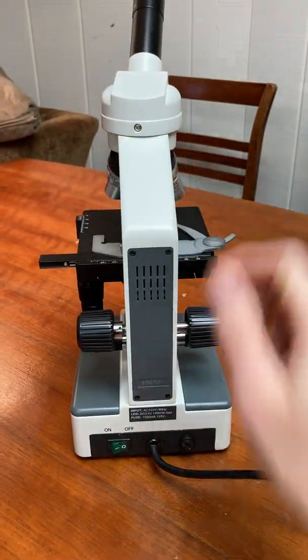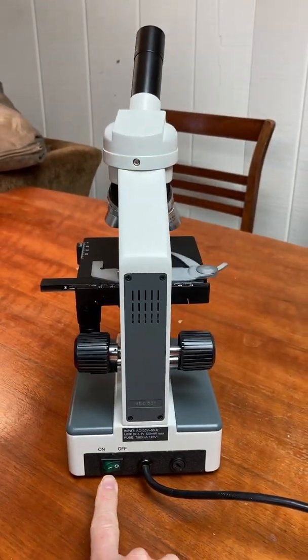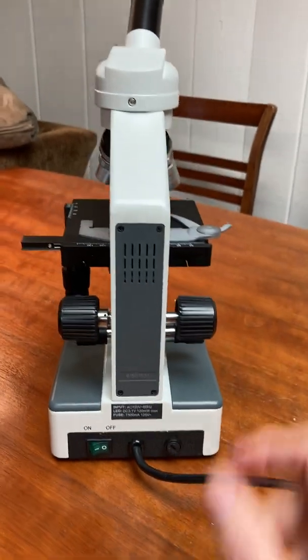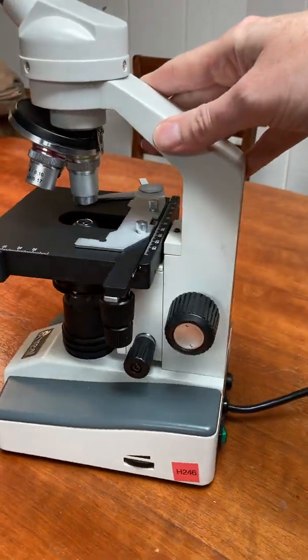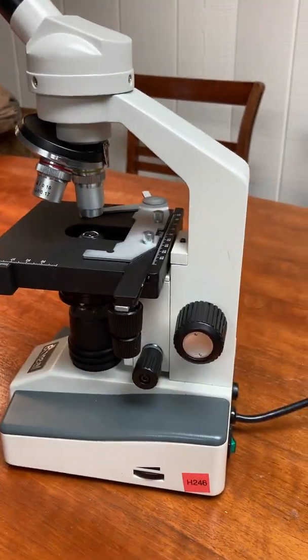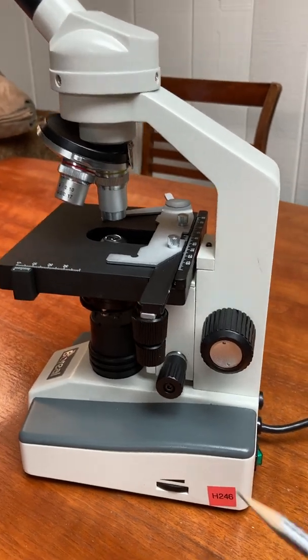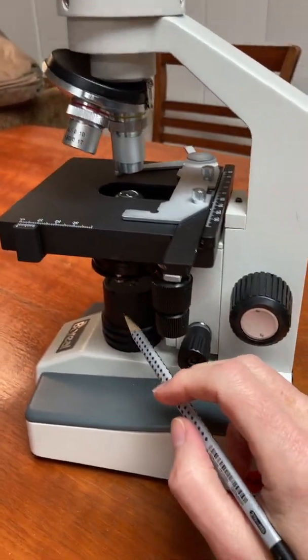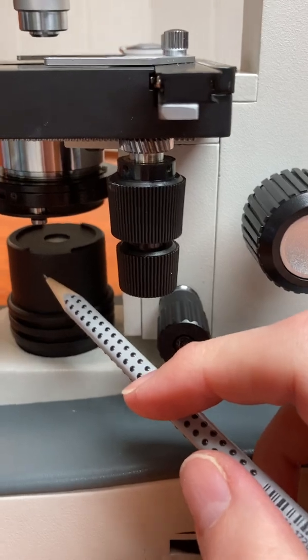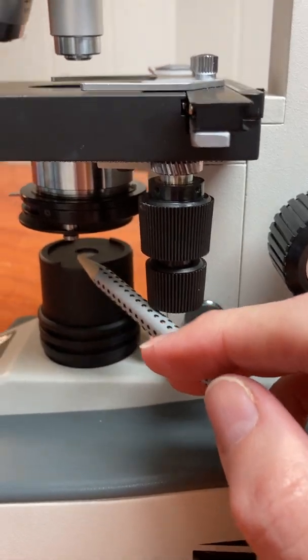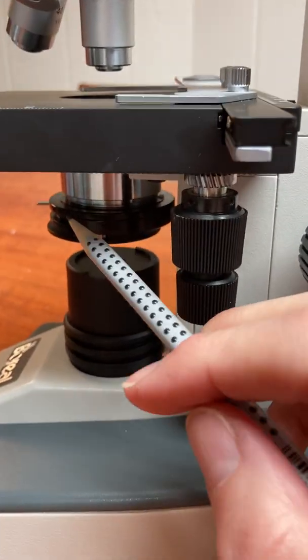This is the power button down here on the back and of course it turns the power on. What that really means is that it turns the lamp on.